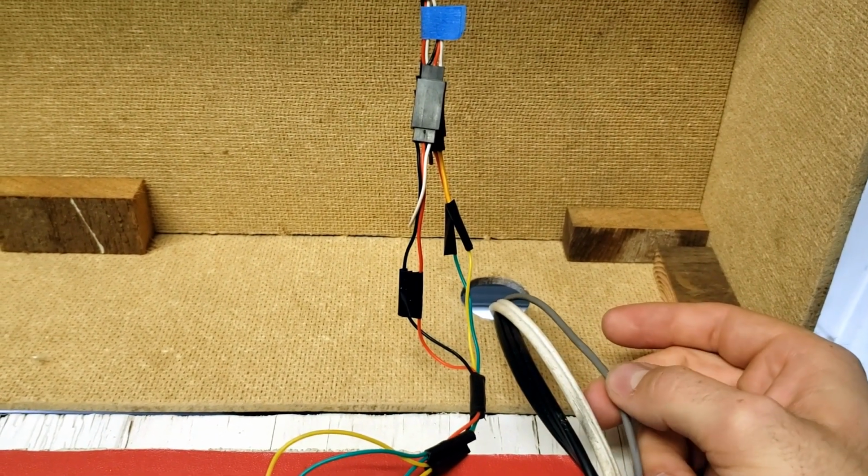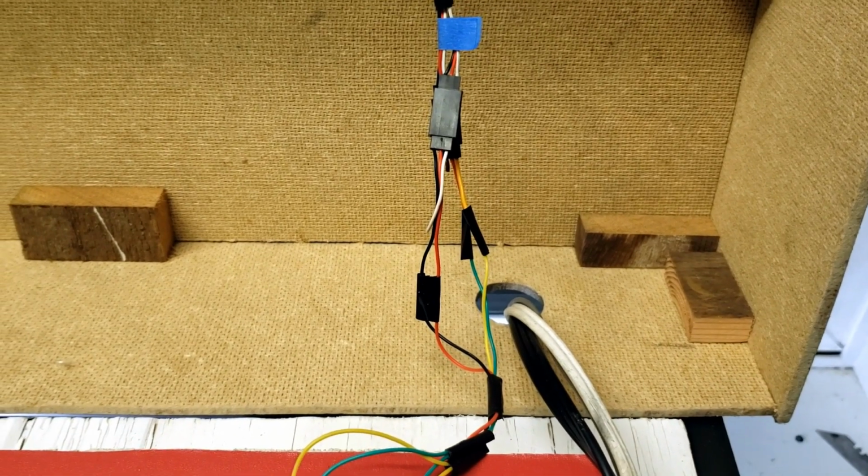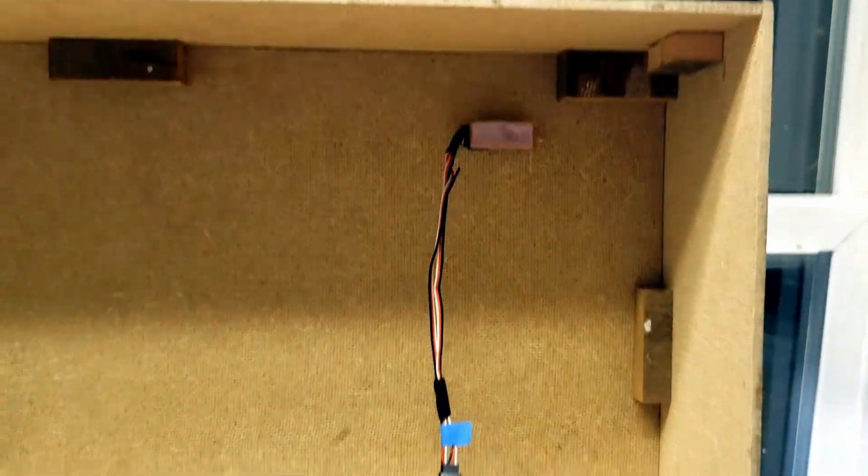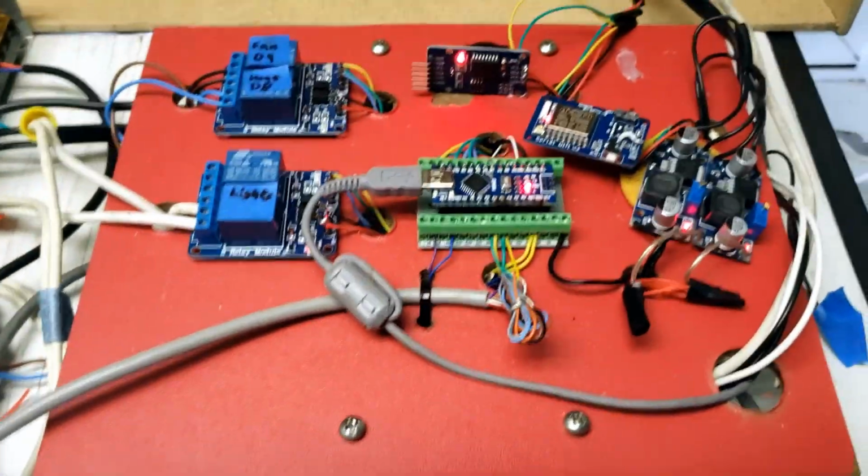And then I have my USB programming cable, and that way I can program on the fly without having to open this thing up. Up there, I have the little LCD screen you saw previously. And let's get into the goodies here.